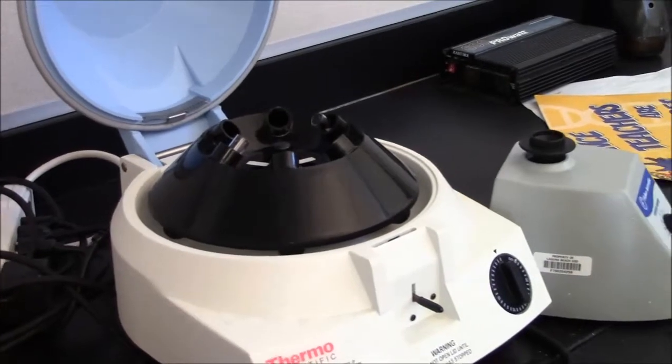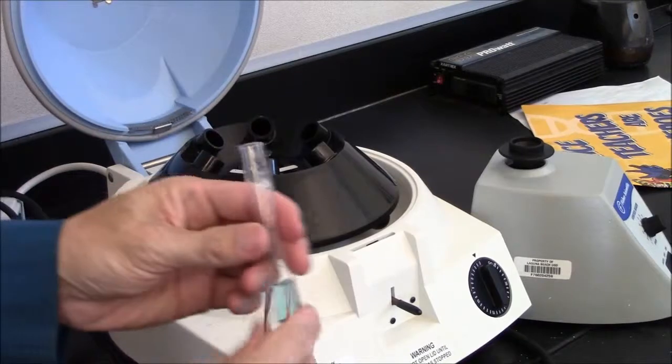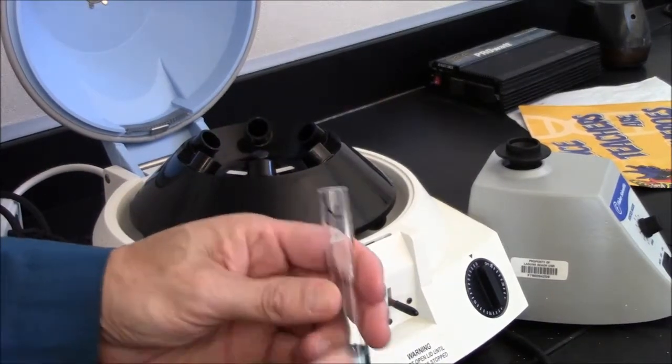Rotation has come to a stop and I can take my tubes out. If I've labeled the tubes, it's easy to tell what's what.